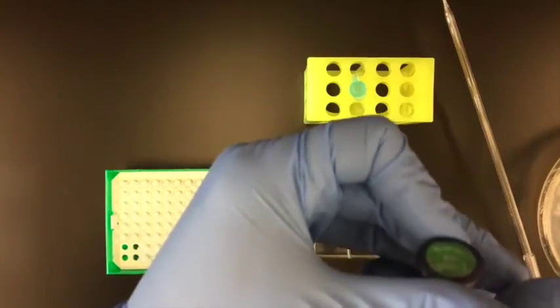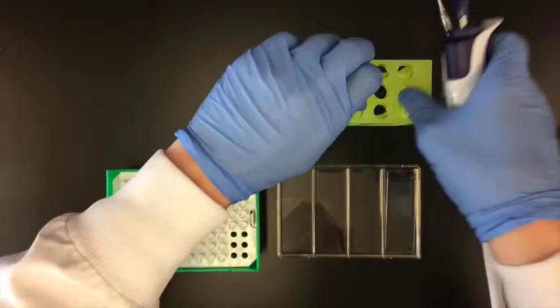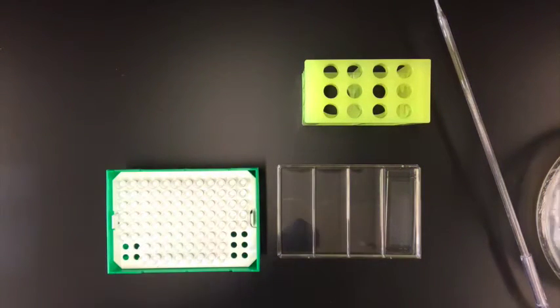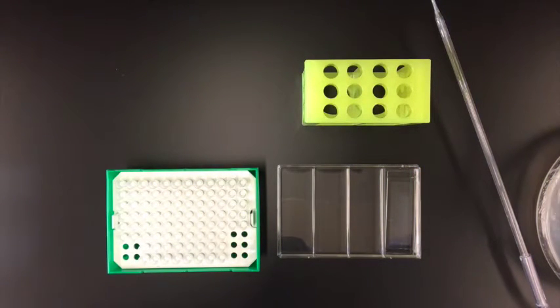So now I'm going to load 200 microliters of my beads, just pipetting directly onto the surface of my array, drop by drop.